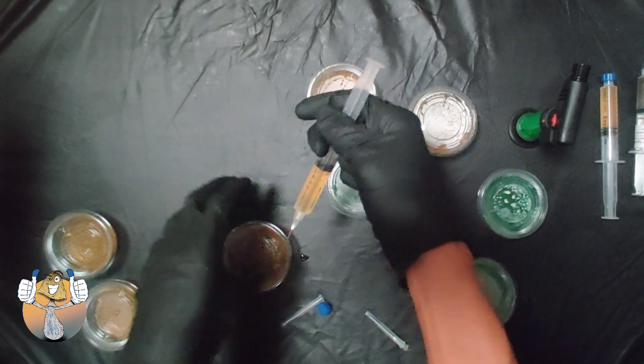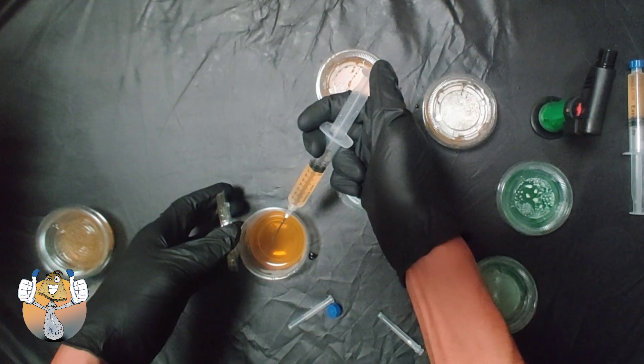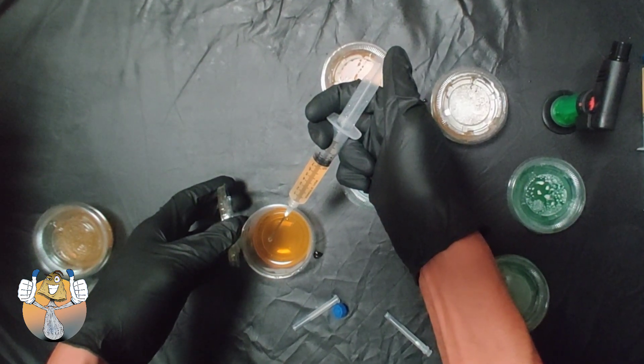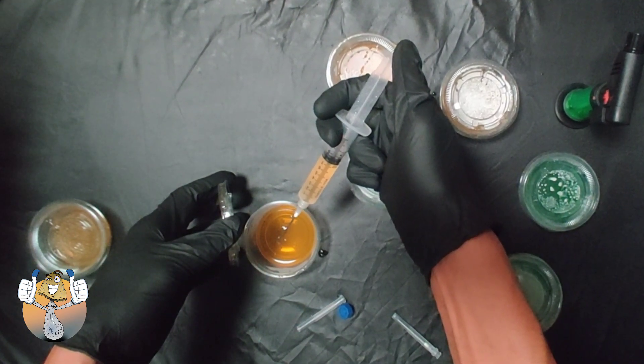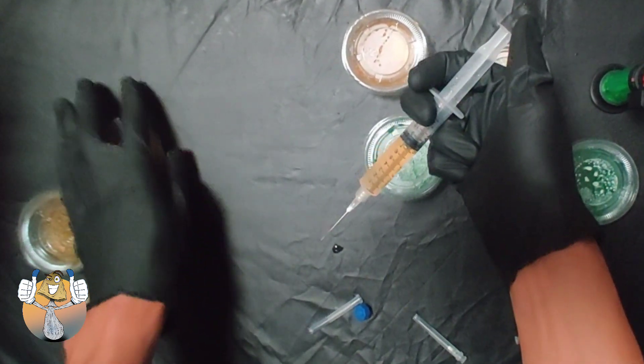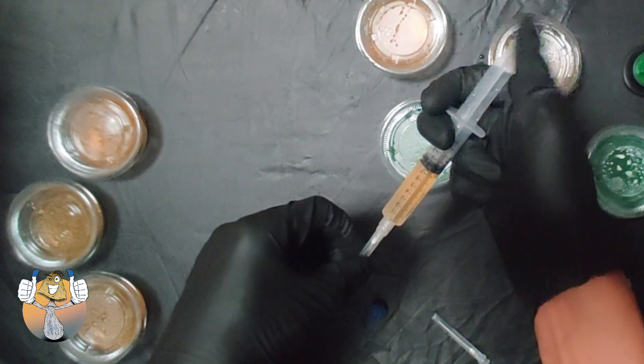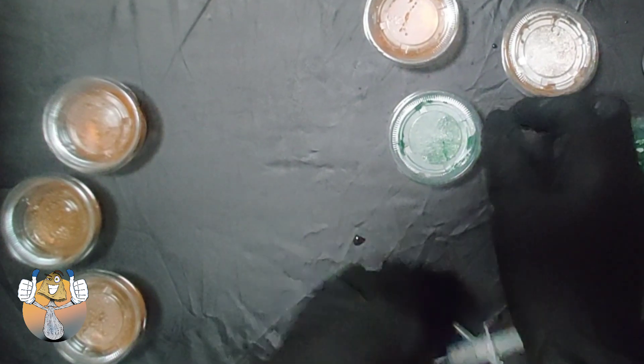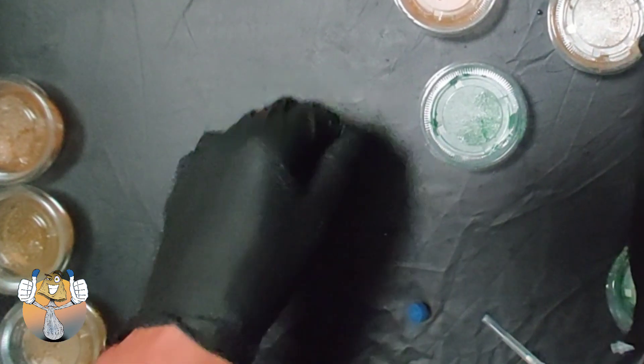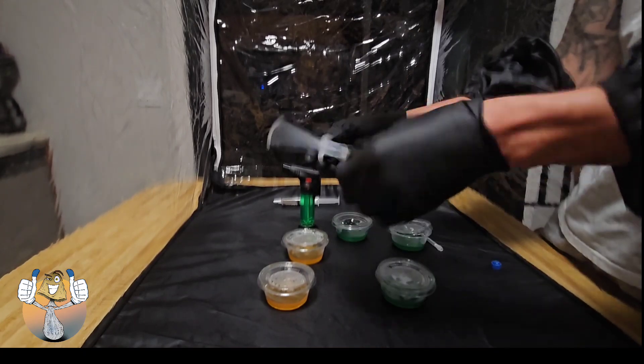Okay, and right here is a perfect example of why you need to let it cool down. You can see a little bit of steam come off the tip of the needle right there. So we're going to just watch that one and see how that does. Okay, so that's it for this one specific variety. We're going to slide that over to the side, keep that organized, and we're going to prepare for the next.